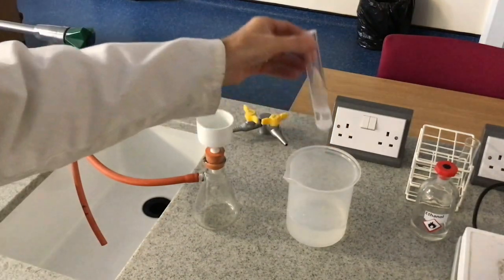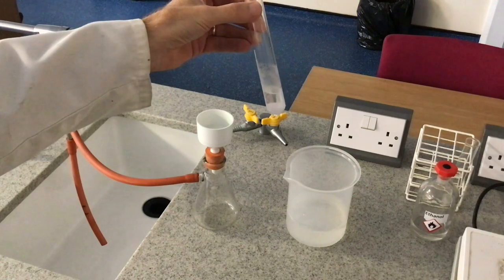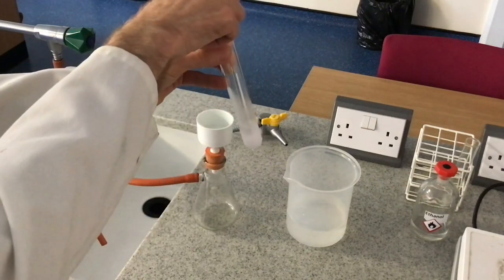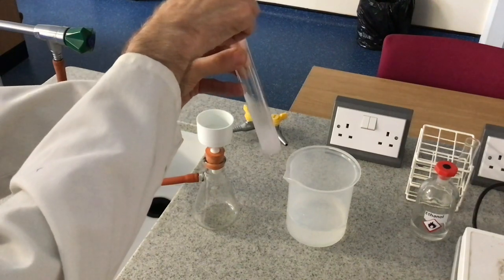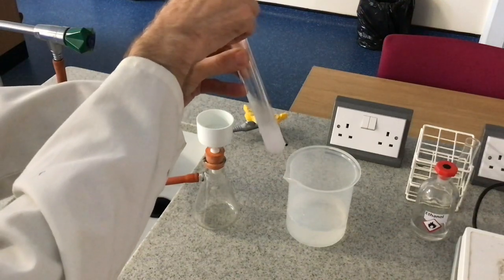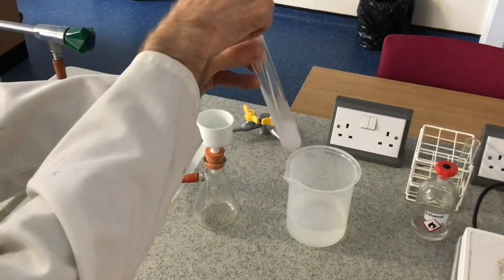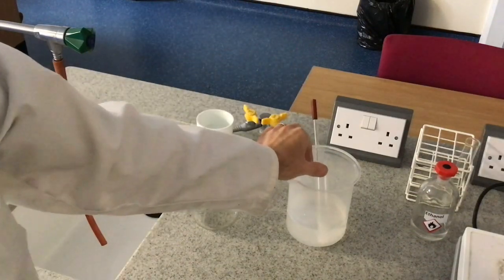After a couple of minutes you can definitely see we've got crystals of aspirin forming. Here's a useful trick: sometimes you don't get any crystals forming initially, so if you take a glass rod and gently scratch the sides of the boiling tube, you're creating microscopic surfaces to encourage the crystals to form. If we didn't have any crystals in there, they would definitely start to form after doing this. I'll put it back in the ice for another couple of minutes and then we'll do the next stage.